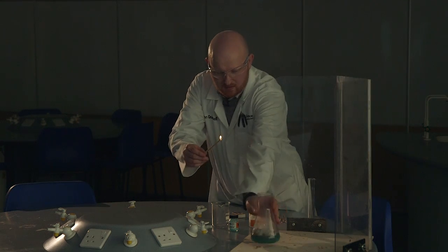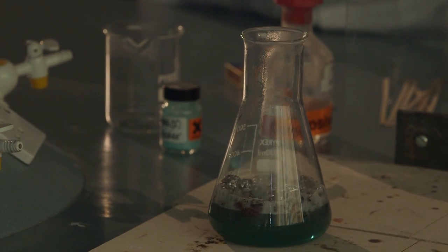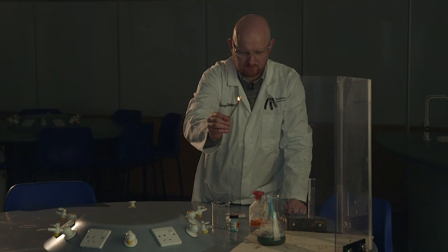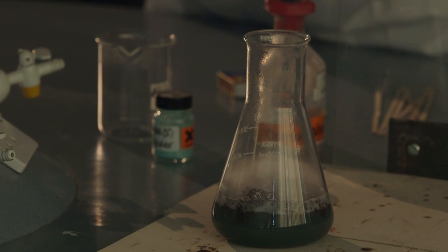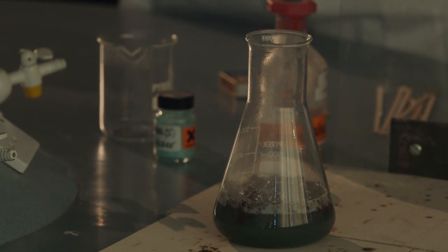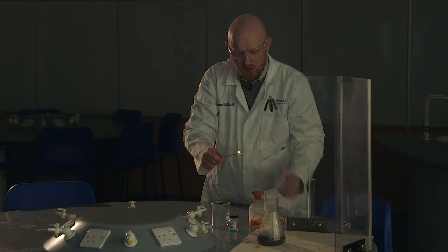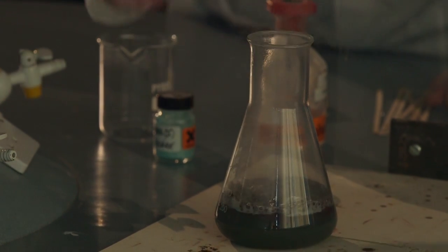Lovely blue-green colour. You can sometimes get it going a few times. This will light the way for Santa to come and deliver our presents — and they really do look like the Northern Lights. We can also show the pupils at the end the copper forming nicely in there.